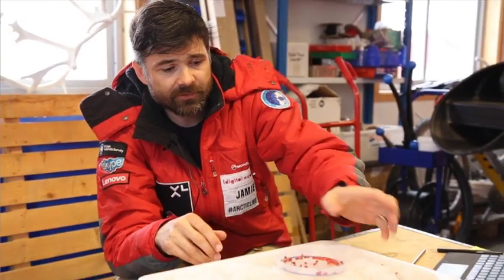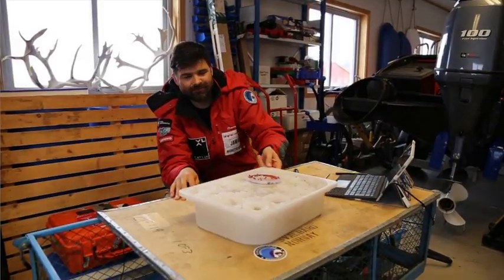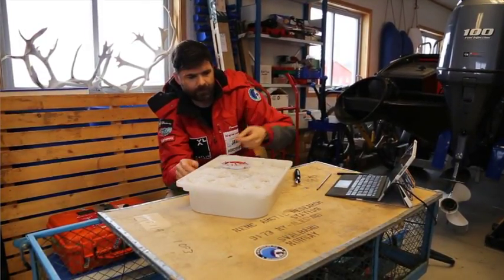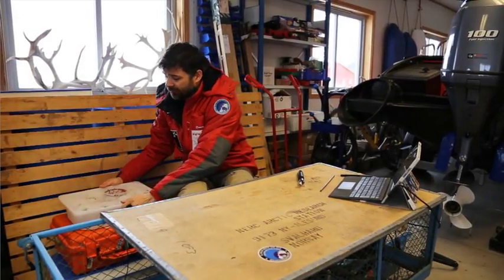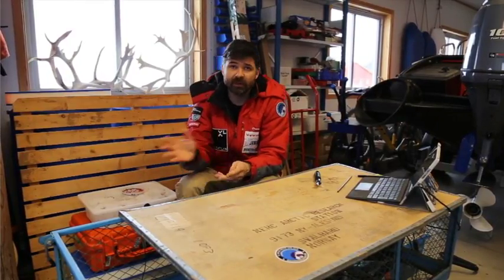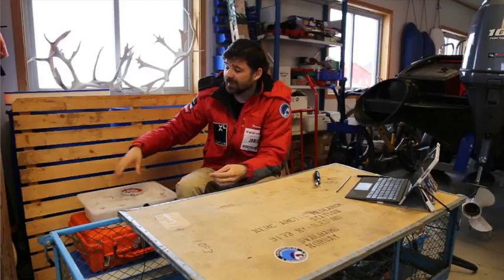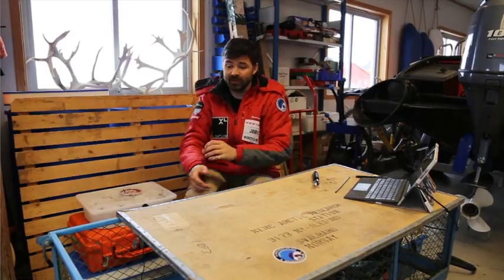It's interesting because this morning we did this and we got an average of about 2.5. The more samples you can take, obviously the better it's going to be, because there might be variation of clusters of plastics. You might miss all those clusters, but the more you take, the more likely it is that you're going to find a good average that accounts for the entire area that you're looking at. And we've been following those general guidelines. I'm just going to take you outside to tell you a little bit about that.